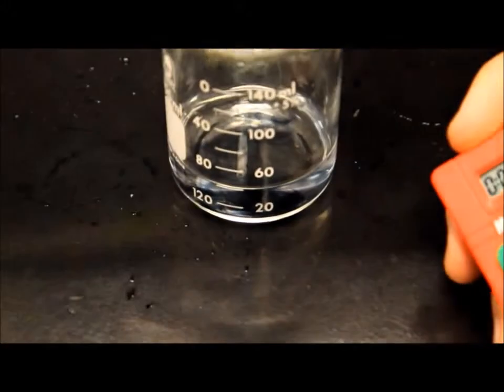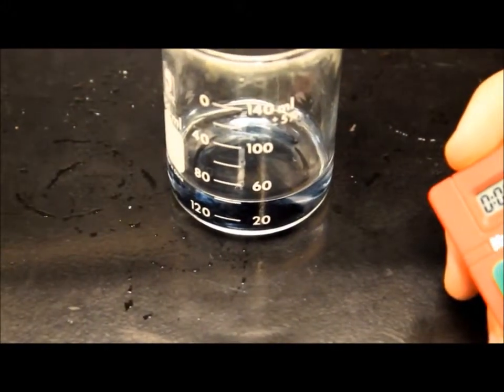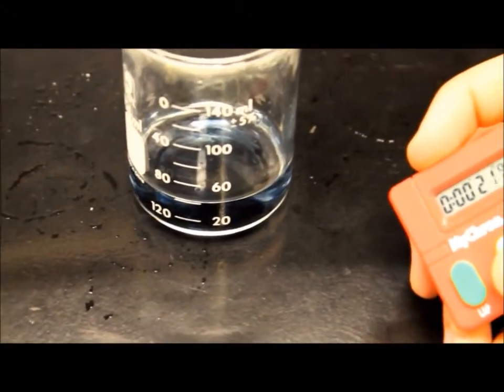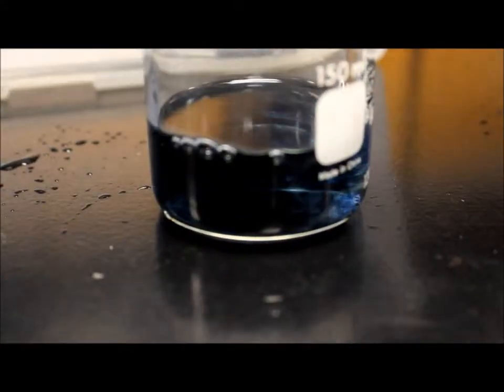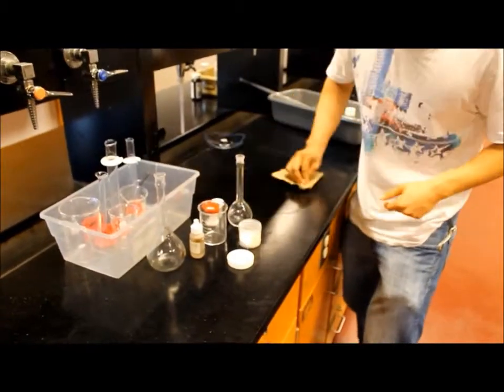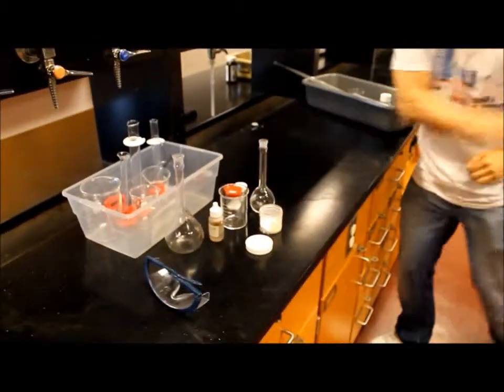Repeat the lab for every trial with the different amounts of solution. You should notice the reaction getting faster and faster. And of course, don't forget to clean up!